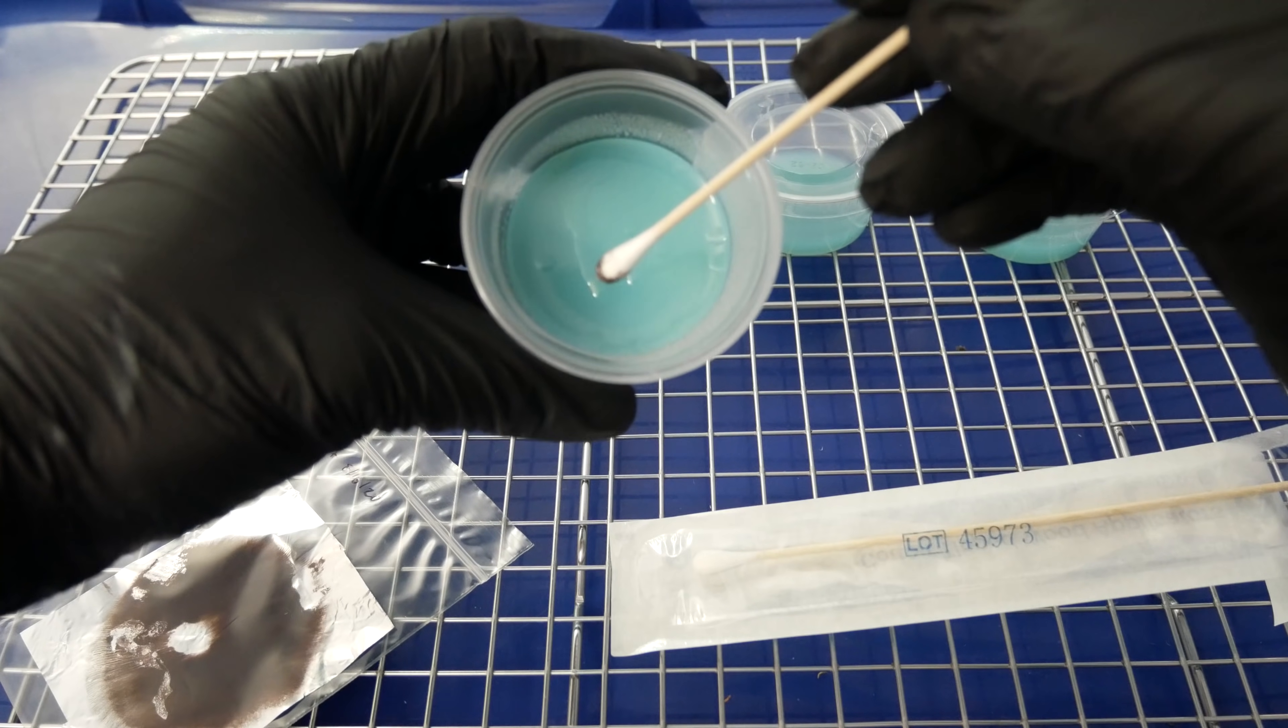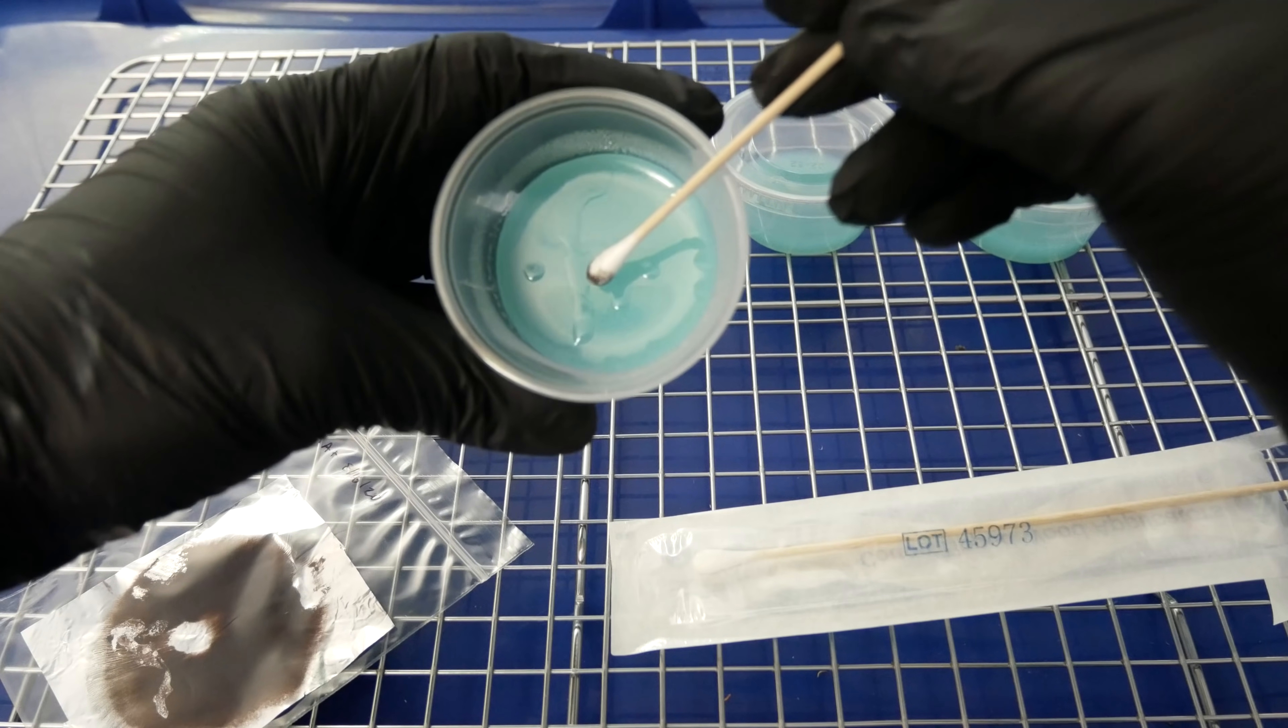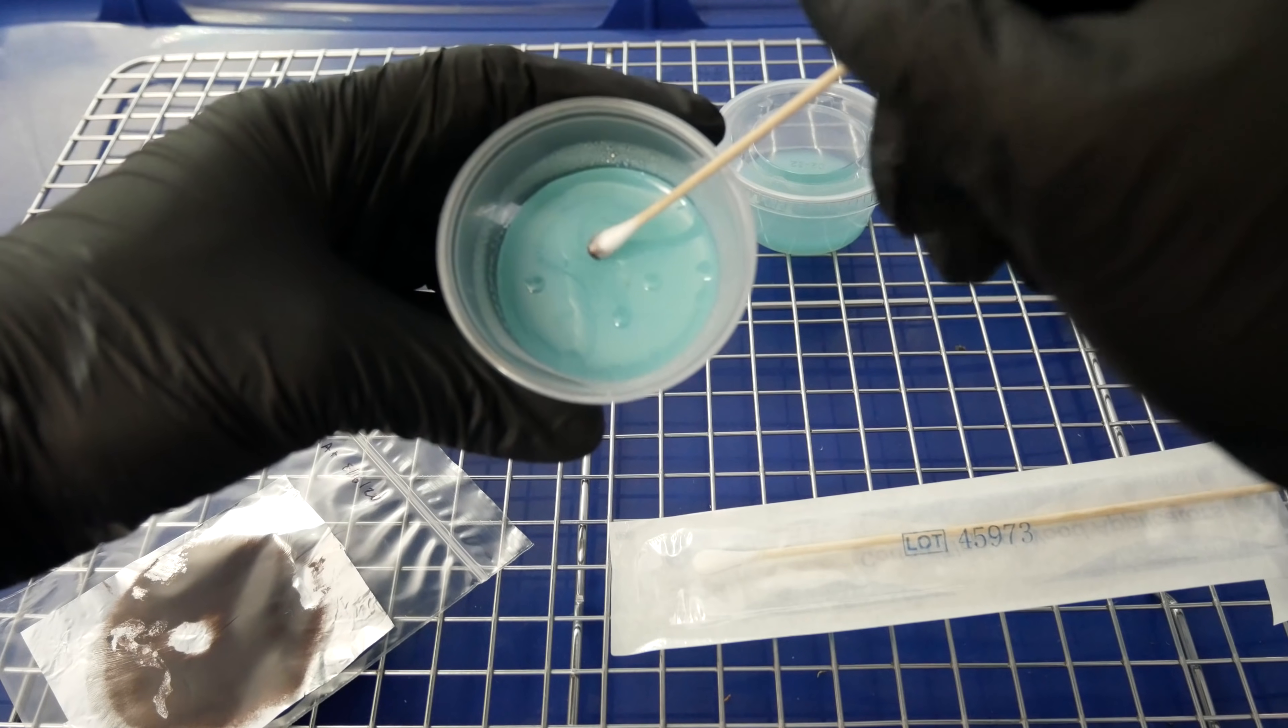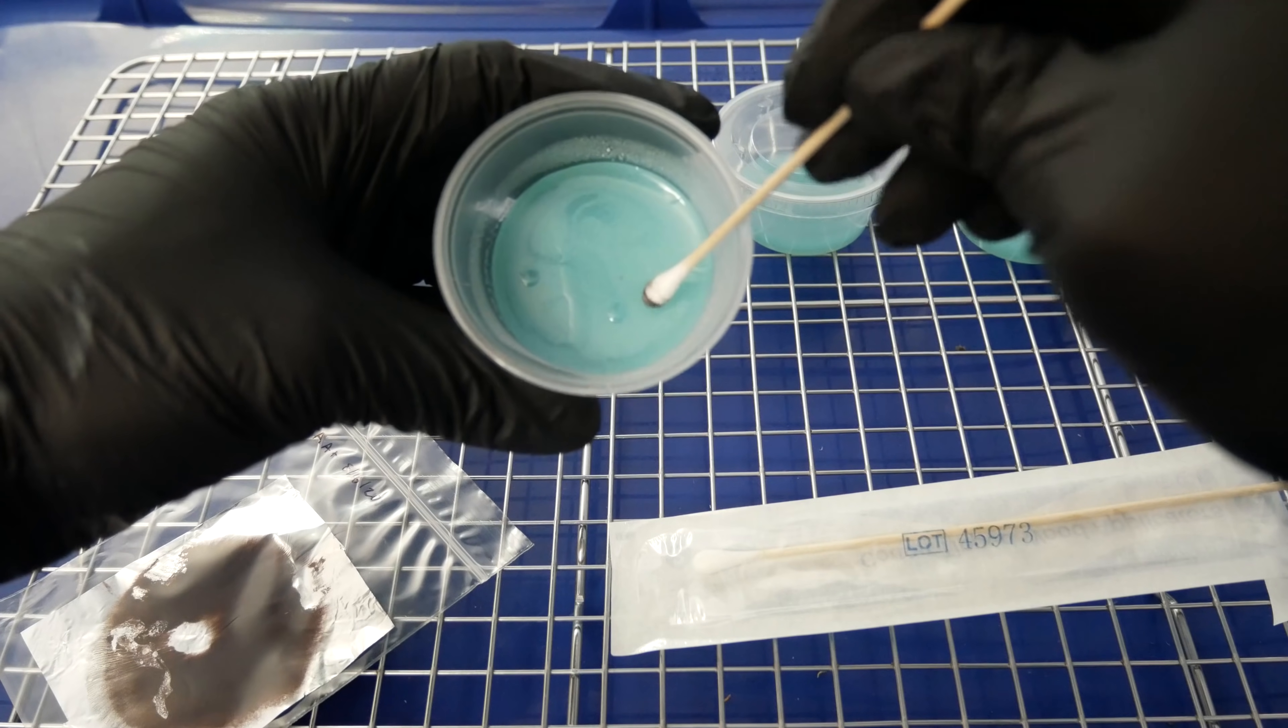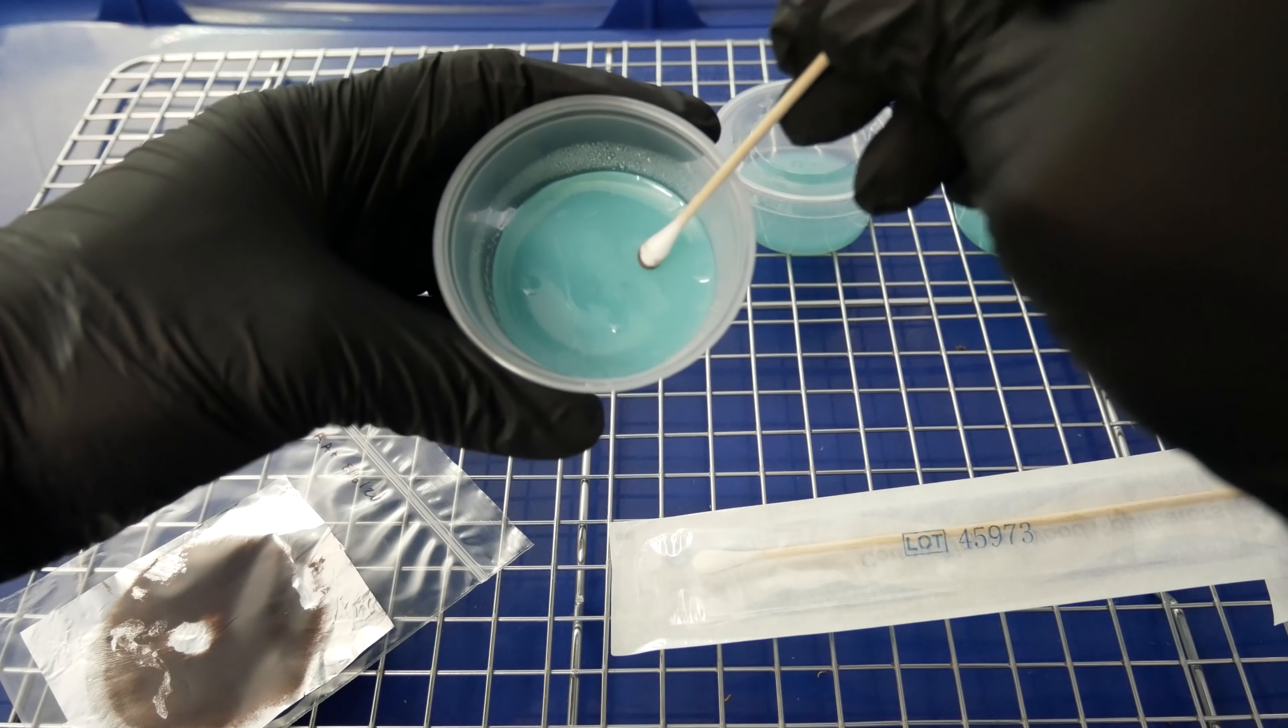Sometimes my agar cups have some moisture on them. This is from condensation. They're still really good to use anyway, so I'm not going to waste a cup. I'm going to use it up anyway.